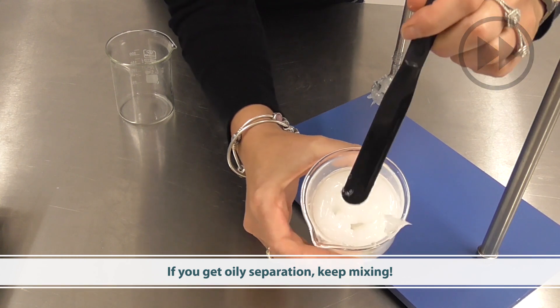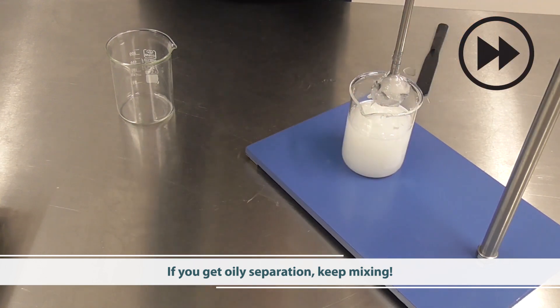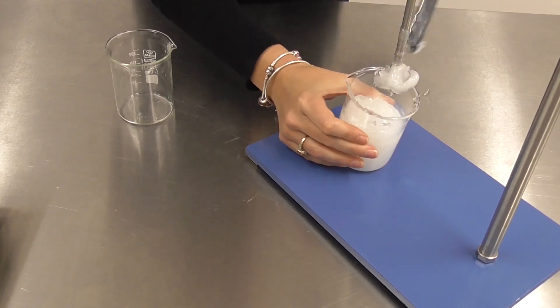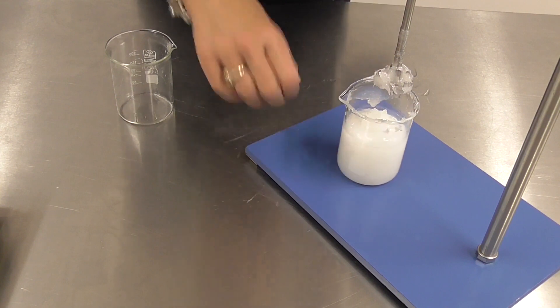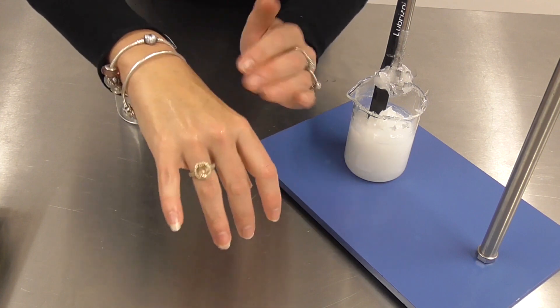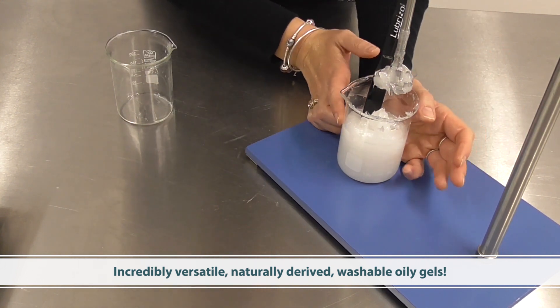If at any point you find you get an oily separation layer, just keep mixing — it will come together. And there you have it: a beautifully thick oily gel that is also quite transparent on application. One of the great things about this material is that it actually contains some glycerin, so you get a beautiful sensory feel on application and it also washes off readily, yet still looks, performs and feels just like an oily gel.